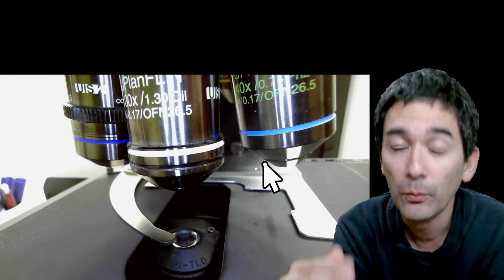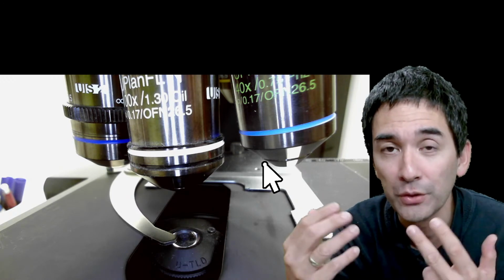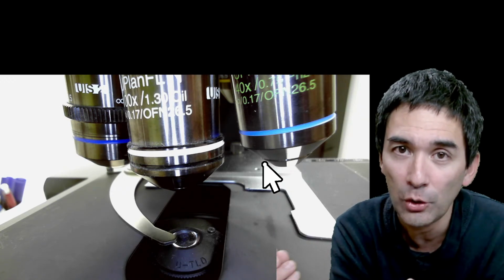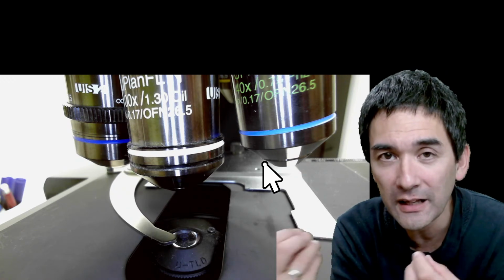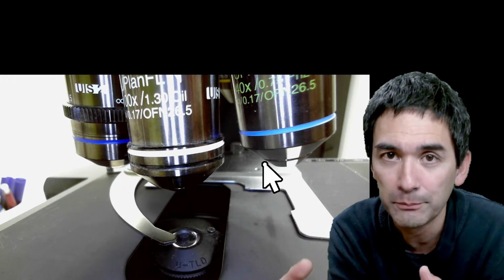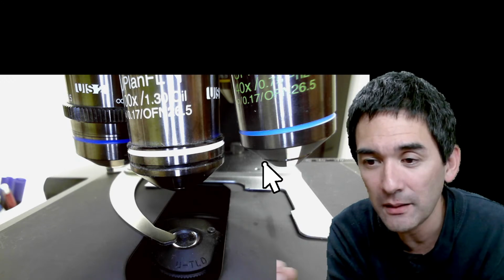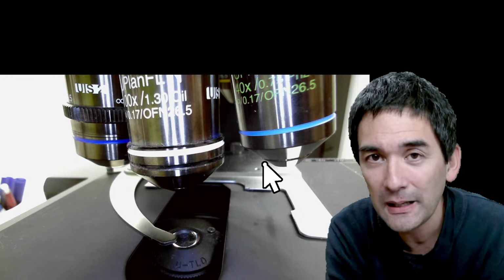Number 3, what I read somewhere is that because halogen has a more natural and a wider spectrum, people who have been working in a hospital with certain staining techniques say it apparently reproduces the stain colors better. Halogen produces more natural colors because the spectrum is wider. So you see, it has advantages and disadvantages.